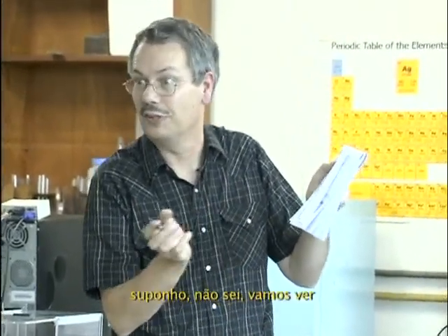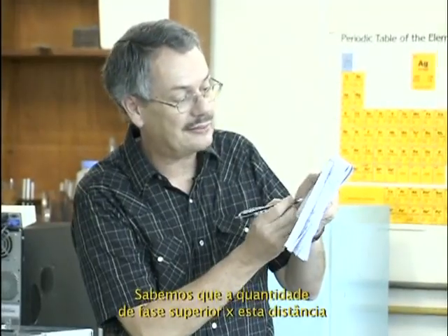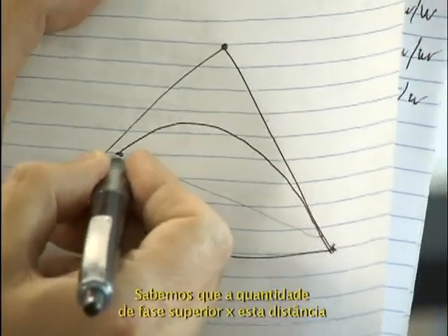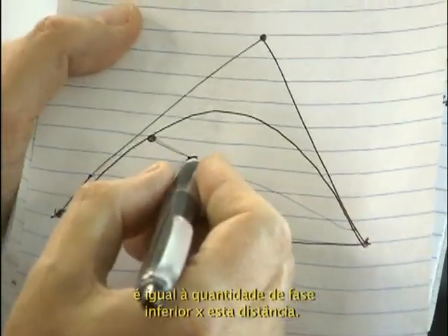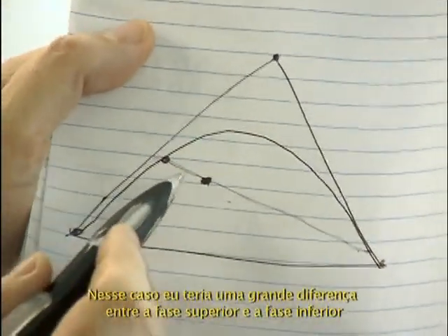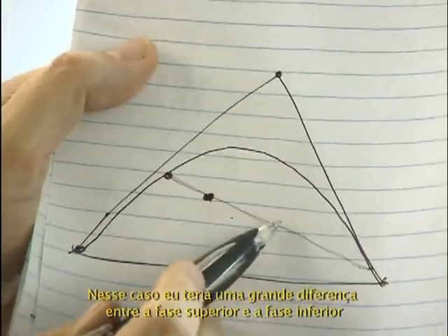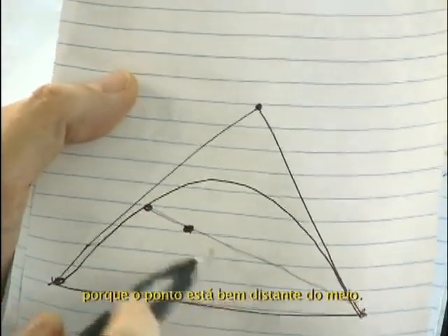I don't know. We'll see. I know that the amount of upper phase times this distance is equal to the amount of lower phase times this distance. So in that case, I would have a big difference between upper phase and lower phase because the point is very much not in the middle.